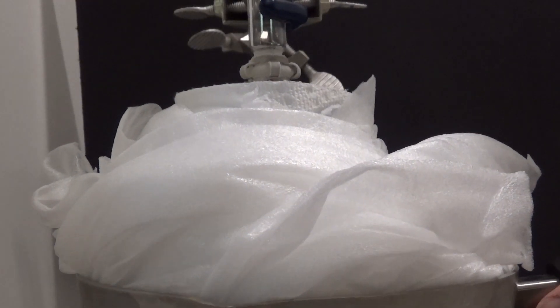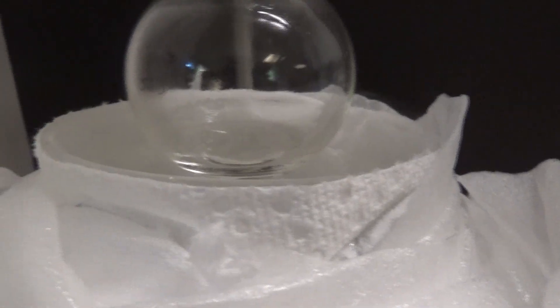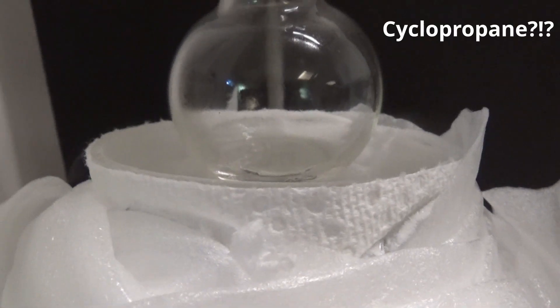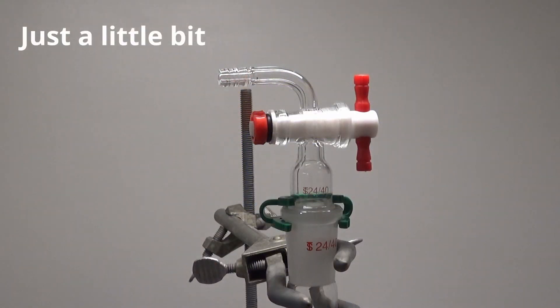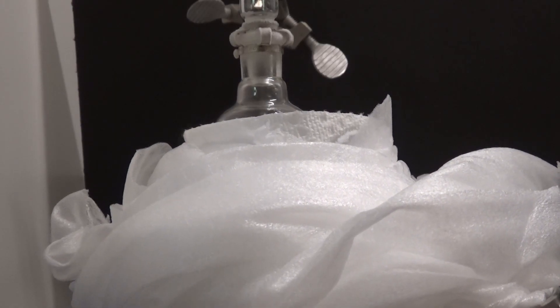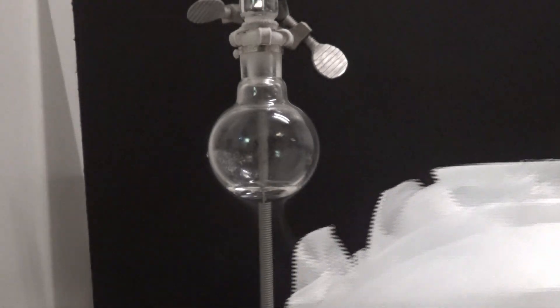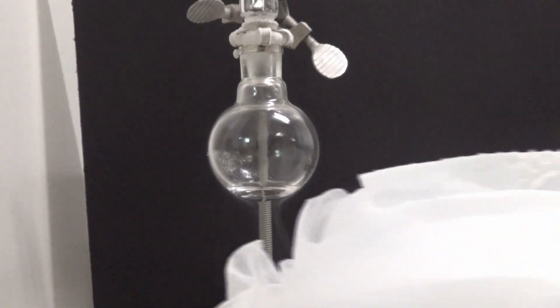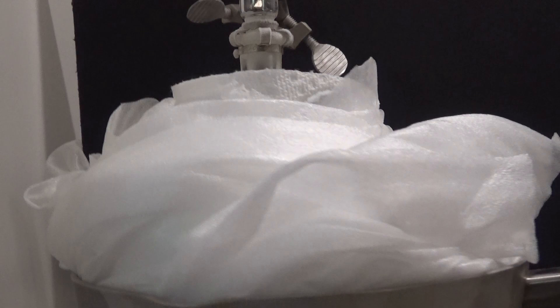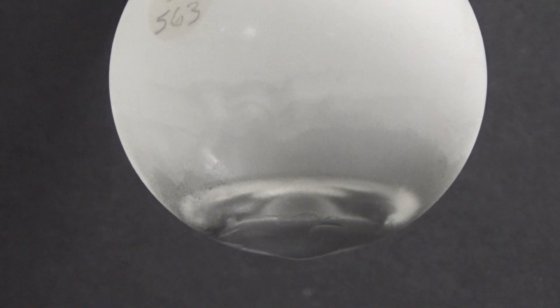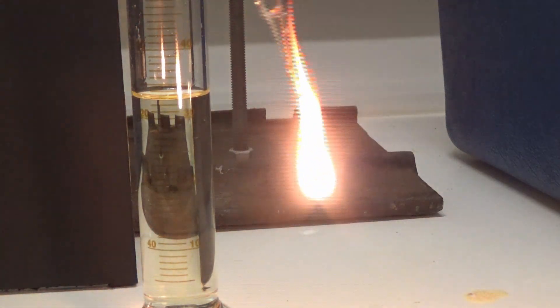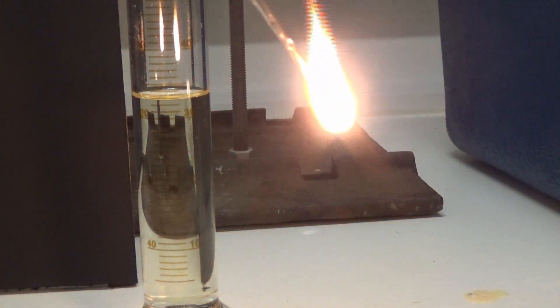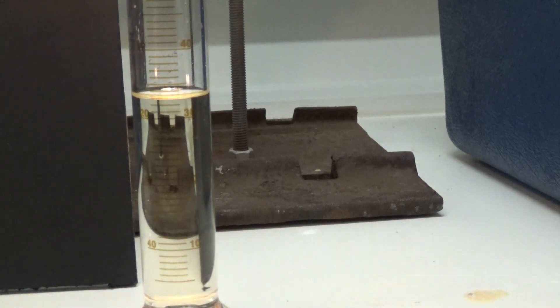I then pulled away the bath to see if I had gotten anything. This looked very promising, and as a preliminary test, I checked to see if anything was flammable. Then I took away the bath again to get a better look. Next, a flammability test. This gave me some real flashbacks.